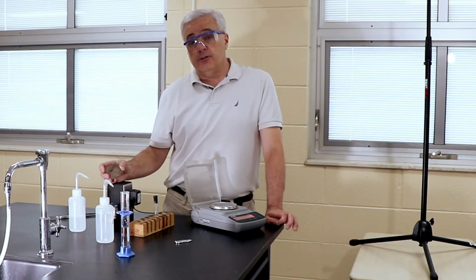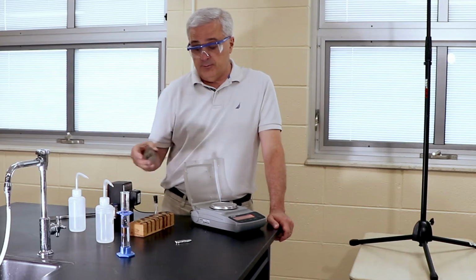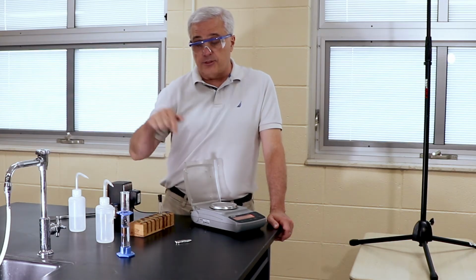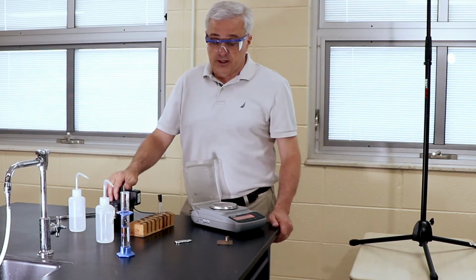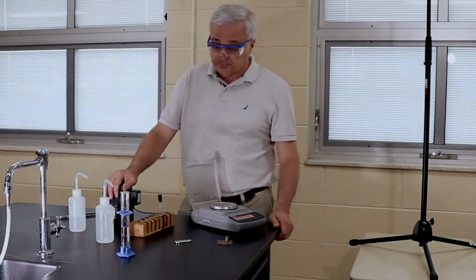All right, so those are the four tests that we're going to run on the sample. Number one is reactivity to water and solubility in water, number two is the density, and number three is magnetivity. So now we're going to move on to the results section of the video, where we're going to actually look at the results and discuss them.